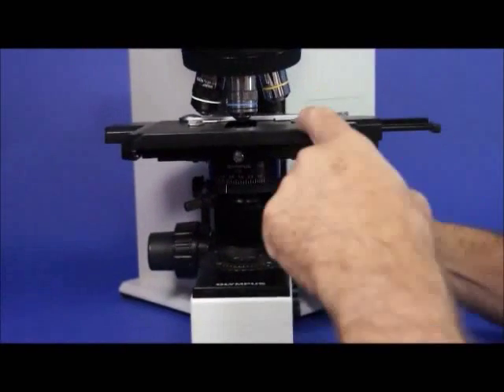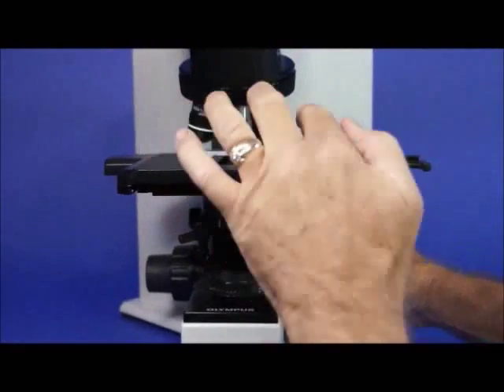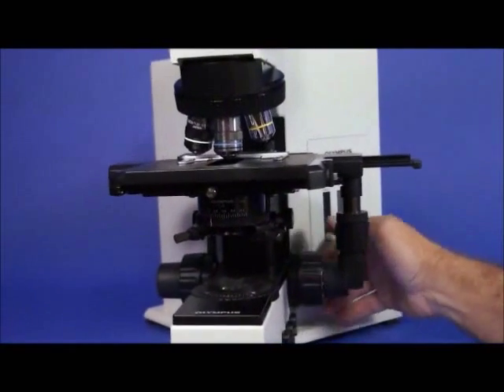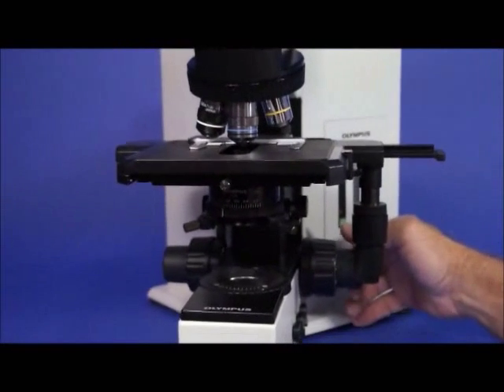It's very nice when you lower the stage and you've already pre-set it. You can come right up all the way to the focal point and you're right there in focus with the specimen.